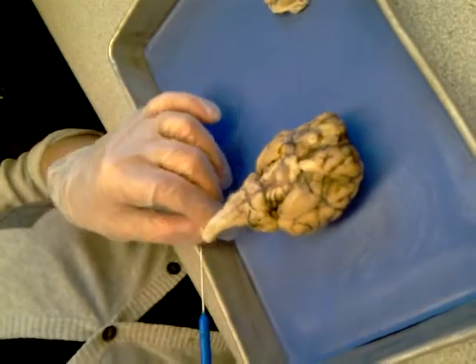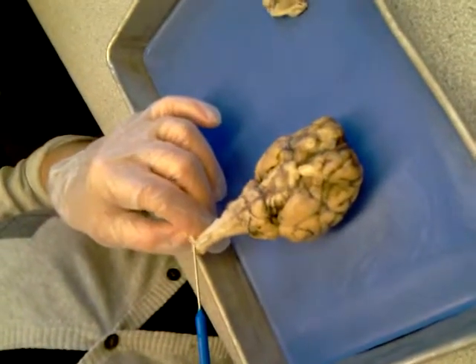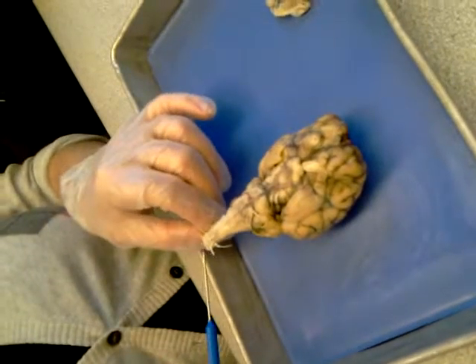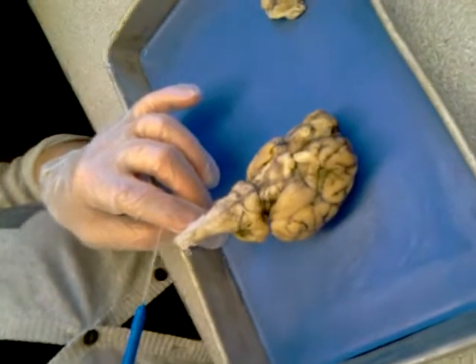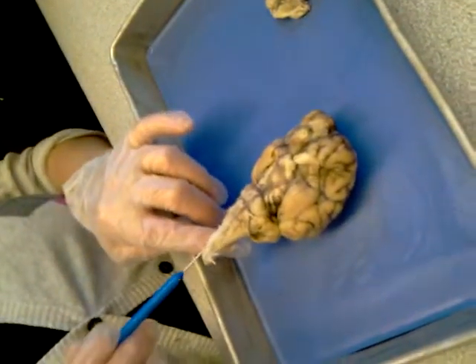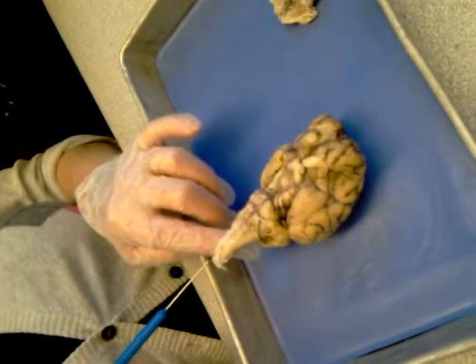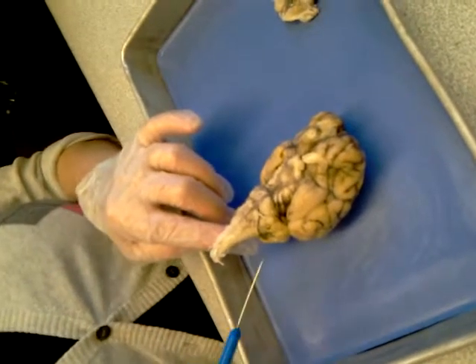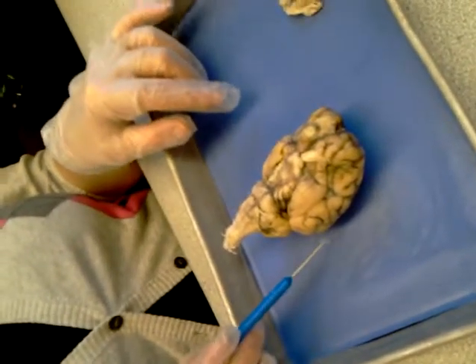And if we're lucky, we may also see some spinal nerve rootlets. I see one little one right there. Okay, and I know some of you had some. So there's some spinal nerve rootlets right here, coming off the spinal cord. Now, there's a blood vessel that follows along a particular little groove right there. What is that groove called? Ventral fissure. Ventral fissure, okay? All right, I think we got all of that.